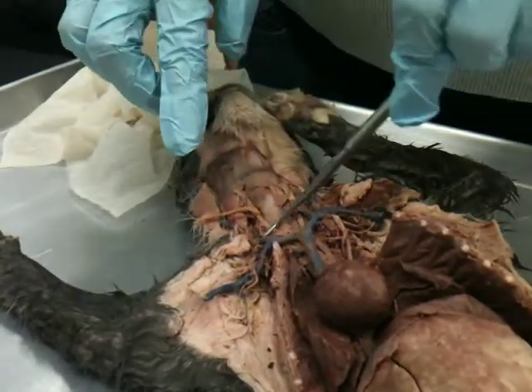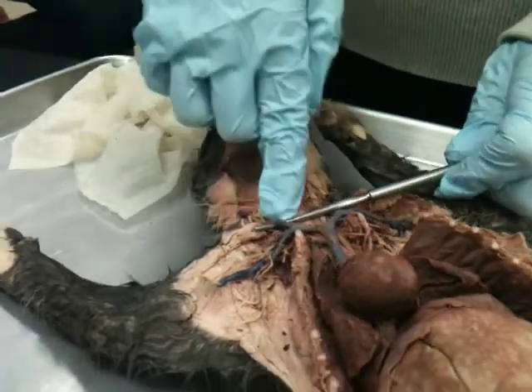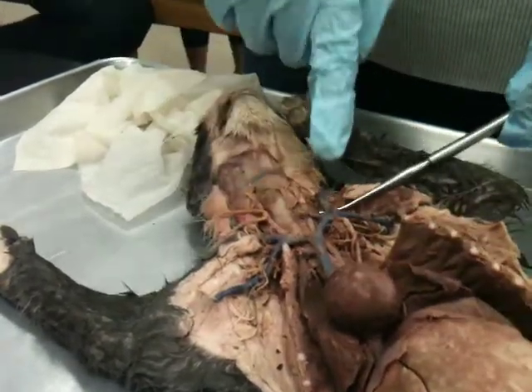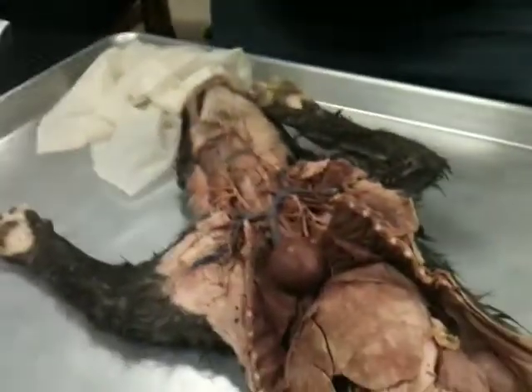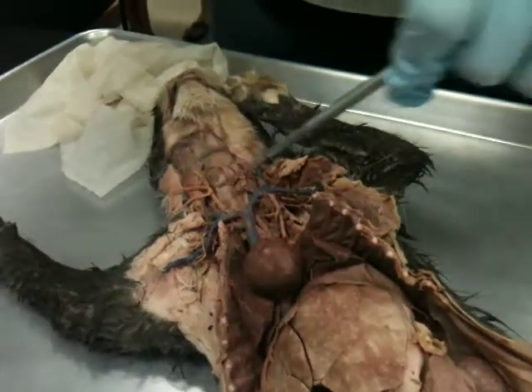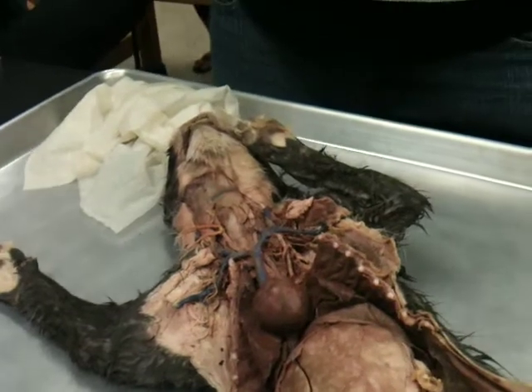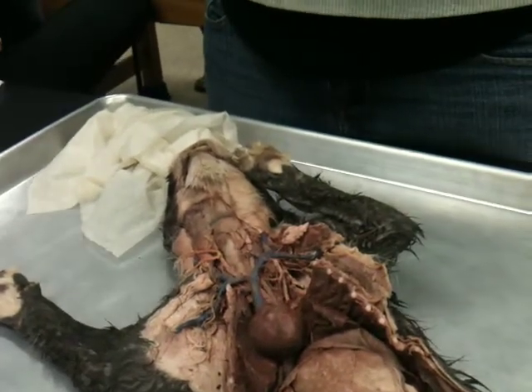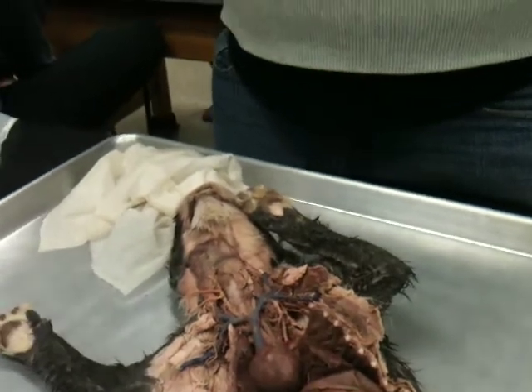Okay. And then you have this big branch that's going up into the neck. That's the jugular, right? Yeah, jugular vein. This is the right jugular vein, and then you have the left jugular vein. Okay, so mirror image is pretty easy. But again, always remember to put whether it's the right or the left. Where are they at, the jugulars? These guys right here that go up into the neck. So they're like a little bit wider. The carotid arteries sort of go right along the trachea, whereas the jugular veins are more to the outside.